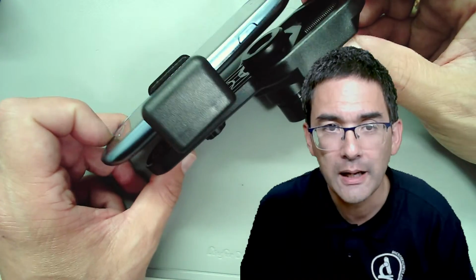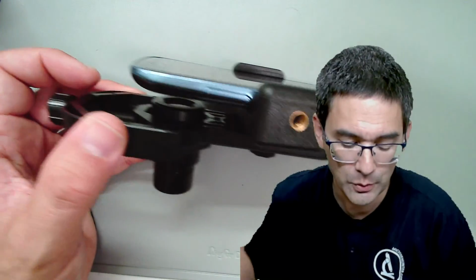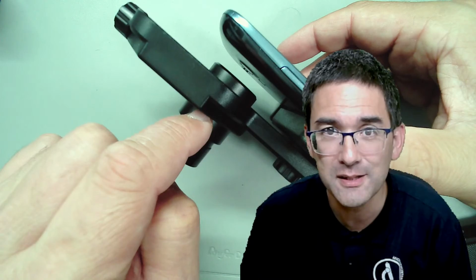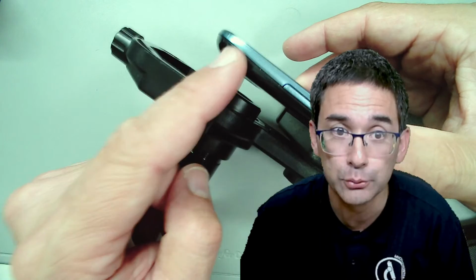And then, of course, you have to use a mobile phone adapter. Do you have to use one? I highly recommend it. Why? Because with a mobile phone, I'm going to use my other one, we're using afocal photography in this case. Over here we have the eyepiece of the microscope, and over here is, of course, the camera lens. And in order for this to work properly, it has to be really properly aligned.